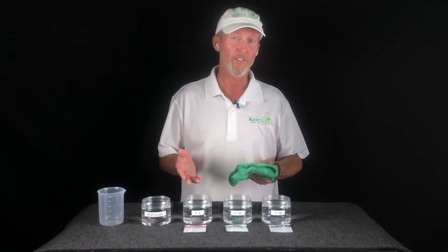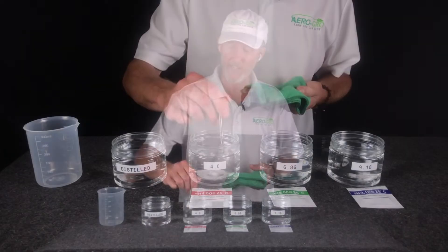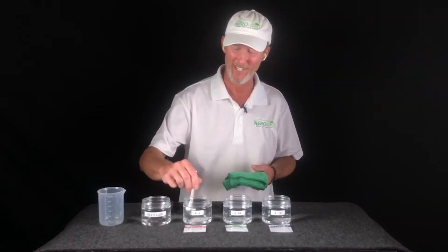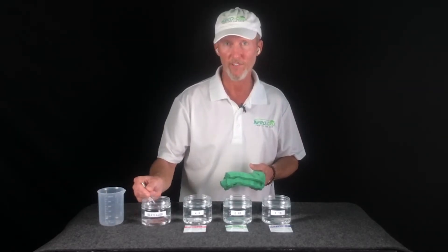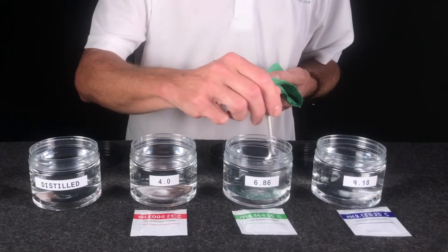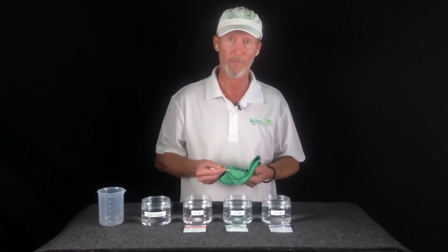To help get the powders totally dissolved, I like to use a teaspoon. Just make sure that whatever you use is made of either metal or plastic and is really clean — it's super important that it's clean. Go ahead and stir the first one, the 4.0. After stirring, always come back to your distilled water, rinse it off, and dry it off completely before moving on to your next solution. Stir, over to the rinse, dry, repeat. Do the same thing every time and you will not have a problem with cross-contamination.